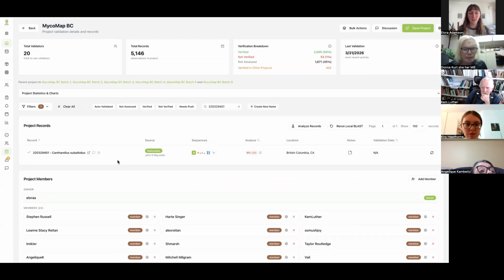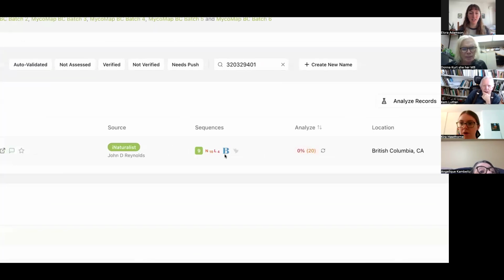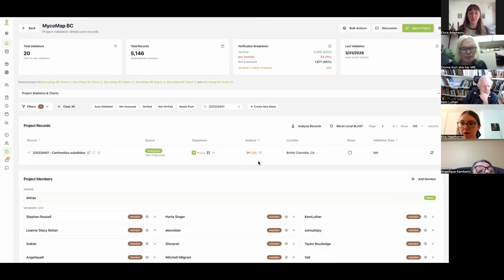Okay. Well, regardless, we've got this chanterelle. It's got 9 associated sequences, and it wasn't able to be auto-validated, which is unsurprising. So let me just close everything I have over here so that I can get all these blasts ready.